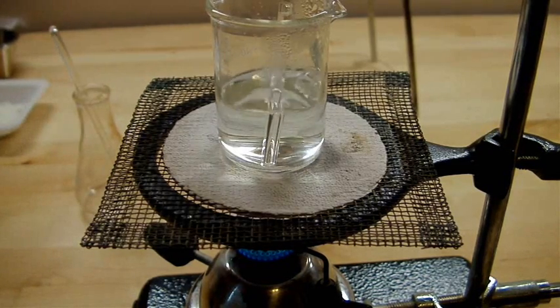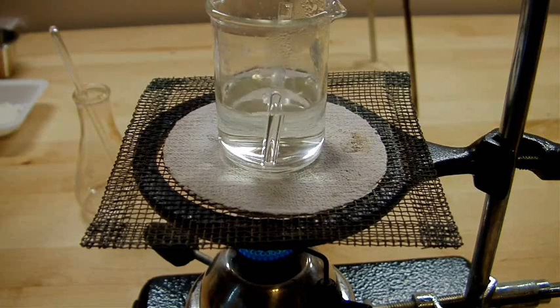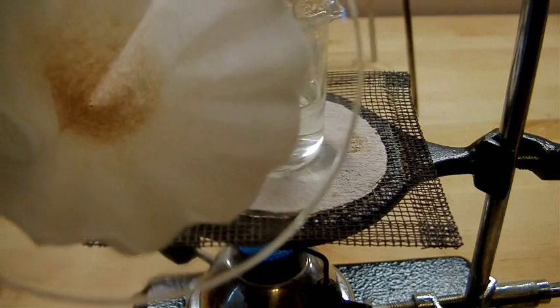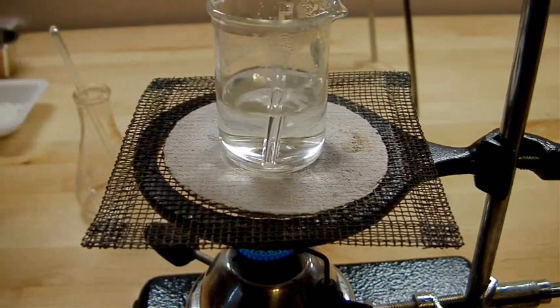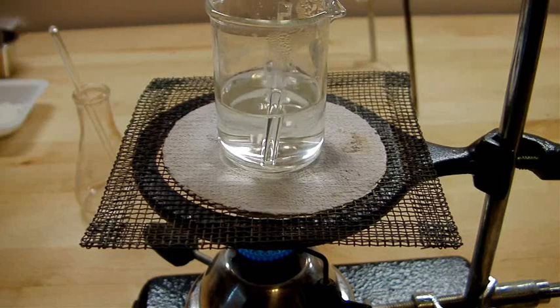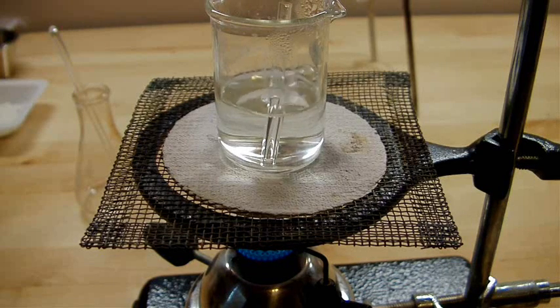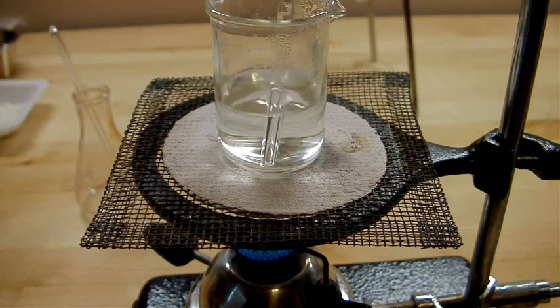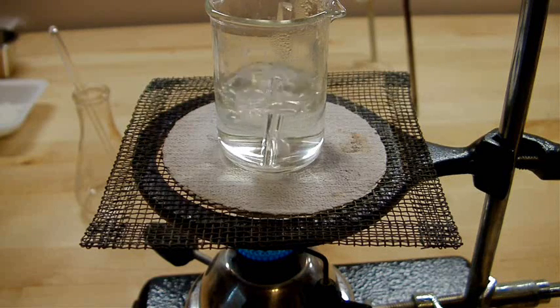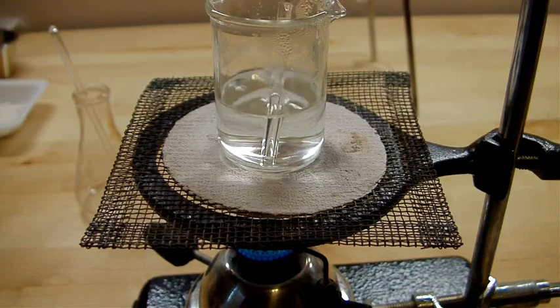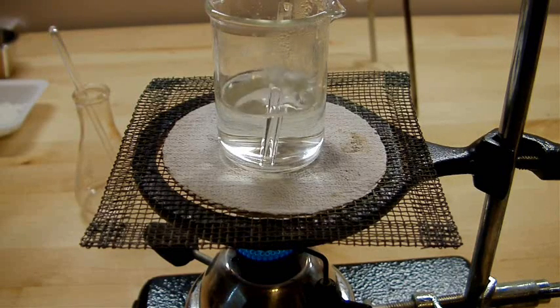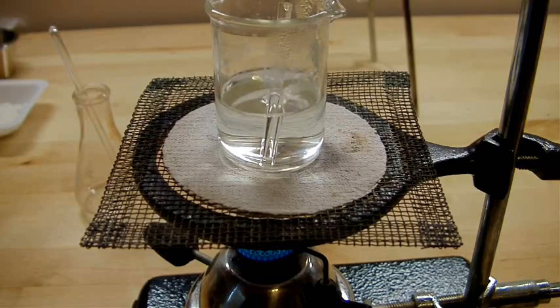So as I said, this is the potassium iodide solution. And what I filtered out of it is potassium iodate, which I have here in the filter paper. I believe that's supposed to be white, but due to iodine contamination, it's going to be a little tan. And what I found from working with iodine compounds is that generally you're going to have to deal with a little bit of iodine contamination no matter what you do. So things that are supposed to come out clear are generally going to be tan or gray or something.